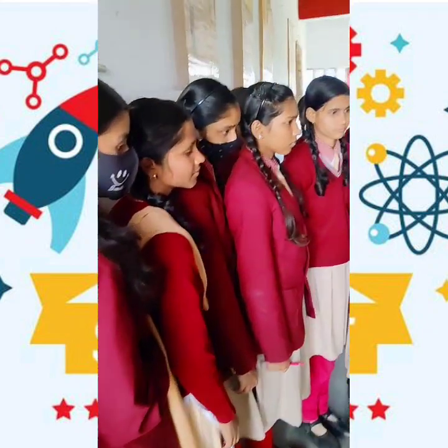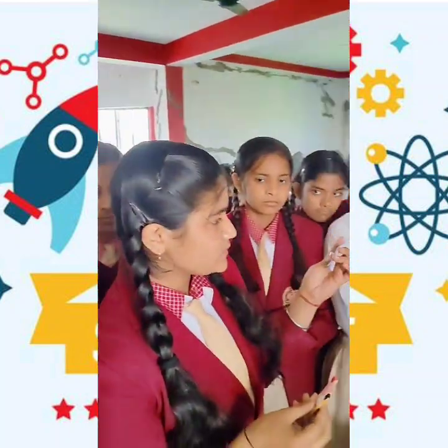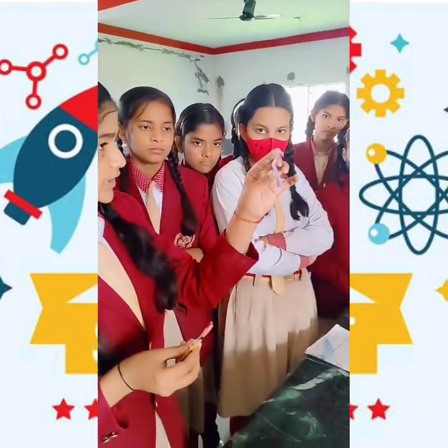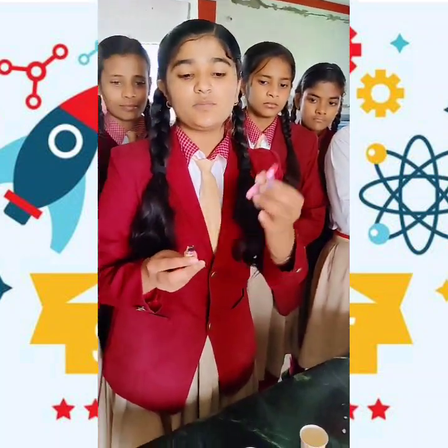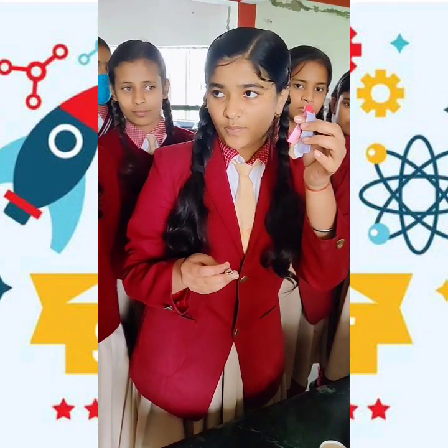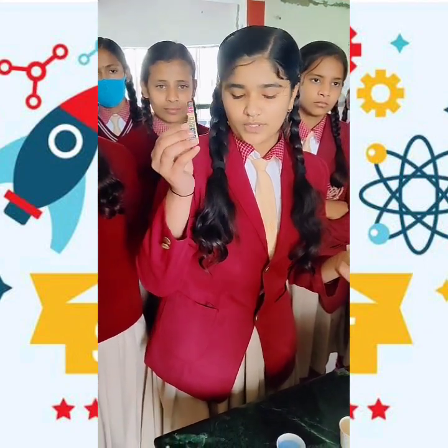You can all see that in my hand I have taken three litmus papers. This is the blue litmus paper, this is the red litmus paper, and this is the turmeric paper.